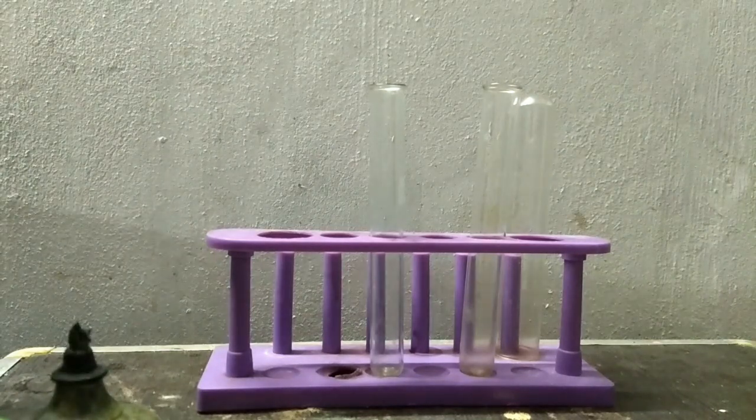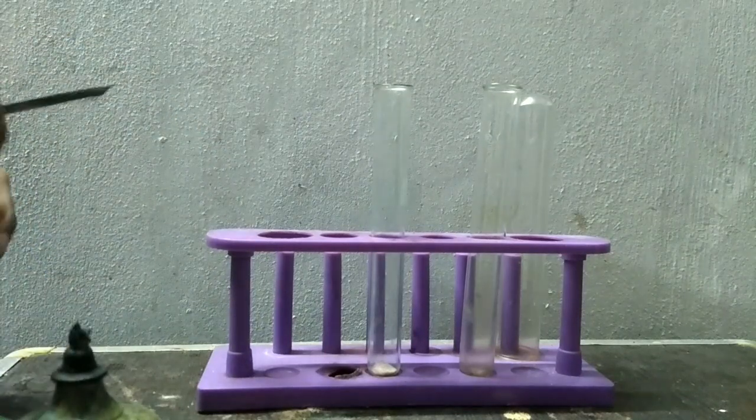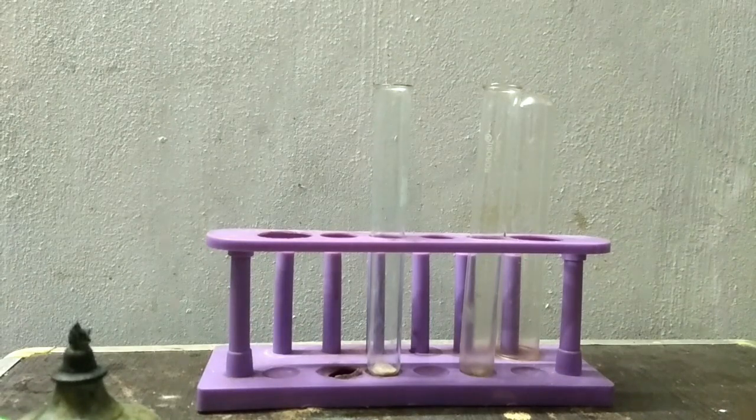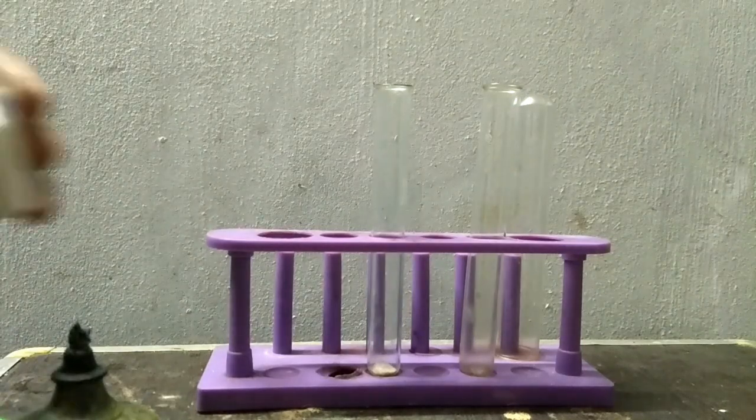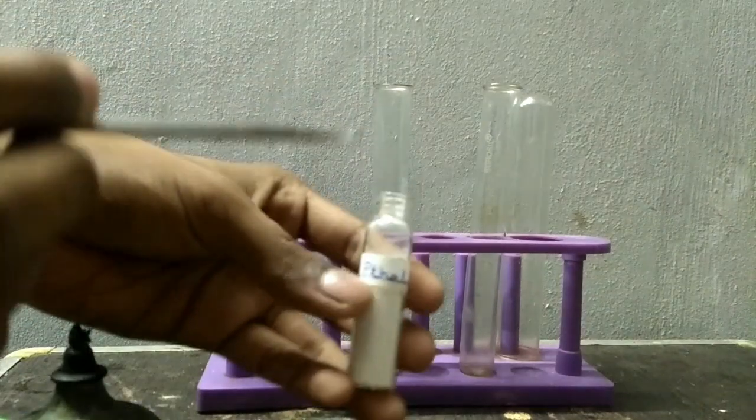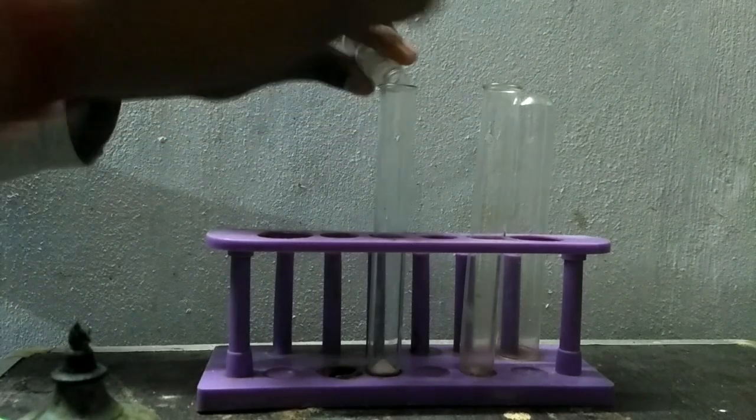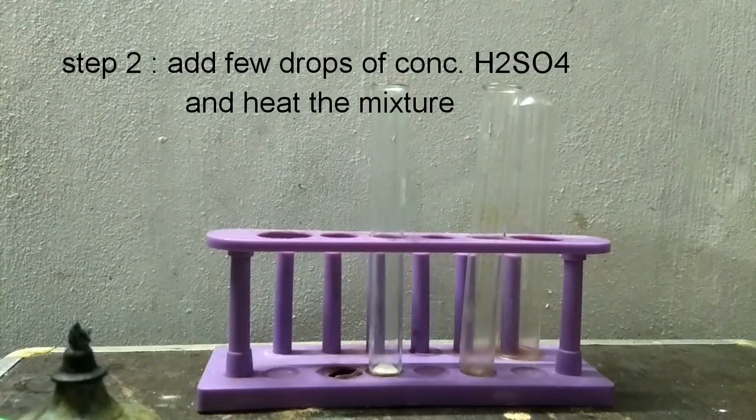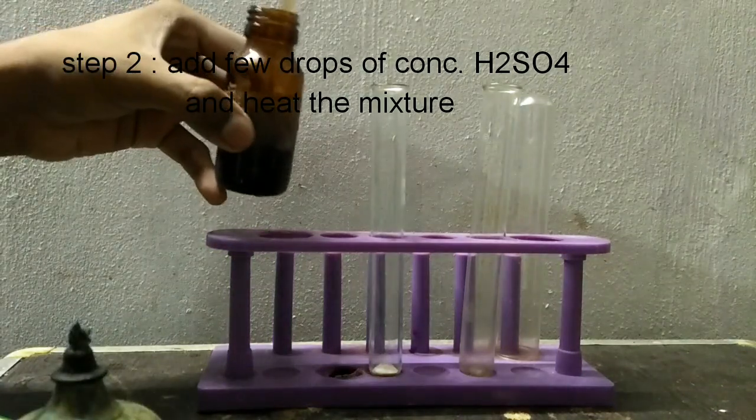Over here I am taking phenol - I have hydroquinone. Then to this phenolic compound we will add phthalic acid or phthalic anhydride.